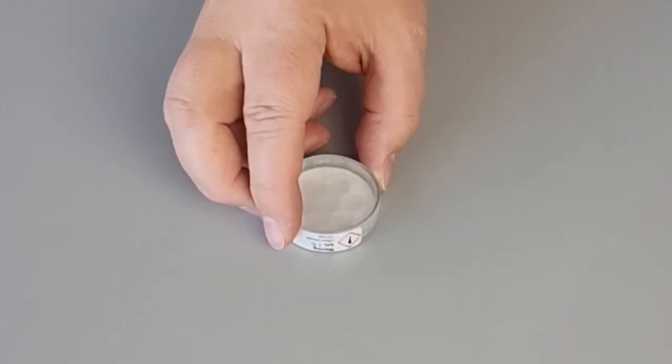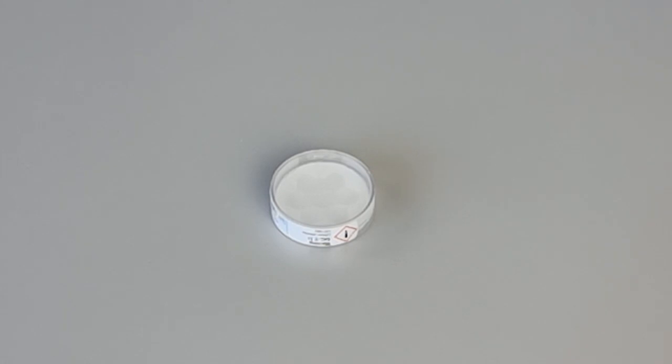Oppositely, a standard whose water activity is higher than room humidity will lose moisture to the room and will start to harden and dry out. Let's take a look at what a standard would look like if you had left it out and not properly stored it. So in our first example, we have a 0.11 standard that was left out to the room.